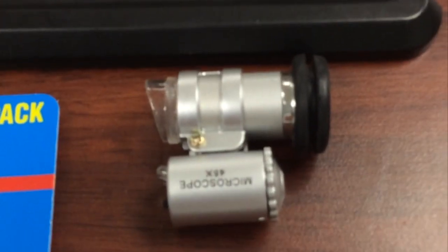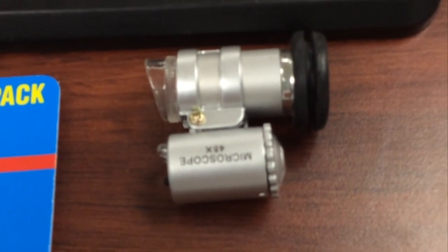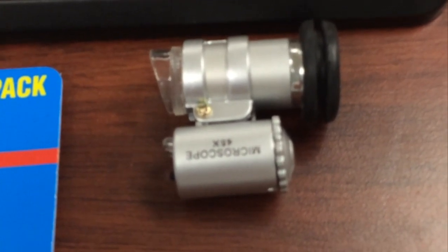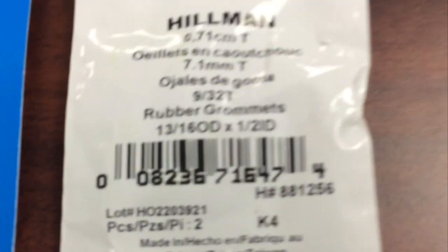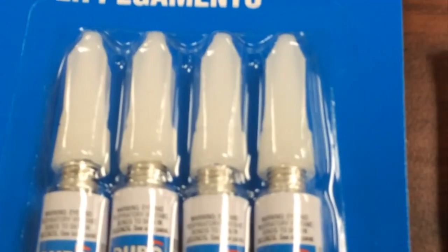What I have here is a little tiny microscope that literally costs under two dollars. I'll post a link on Amazon where you can buy it, because obviously the price is going to change from time to time. I just happened to have one sitting around my nerd cave. You're also going to need a half-inch grommet — I bought this bag here, a pair of two — and some super glue.